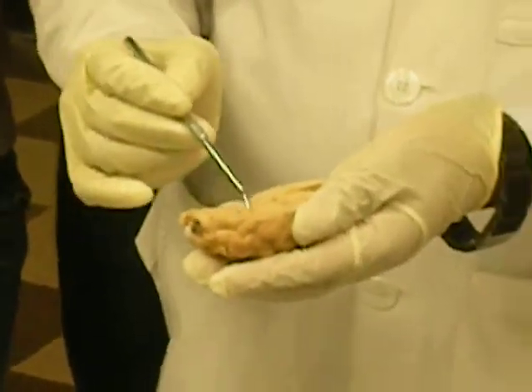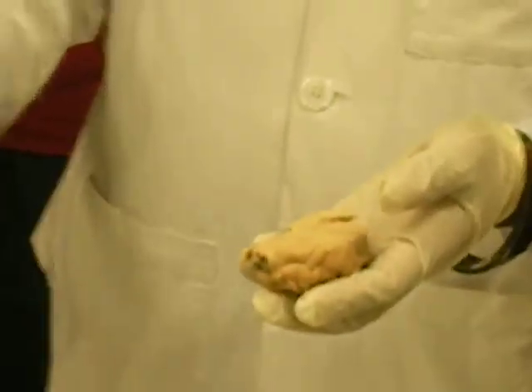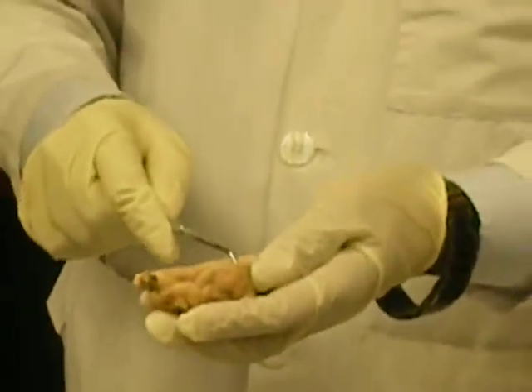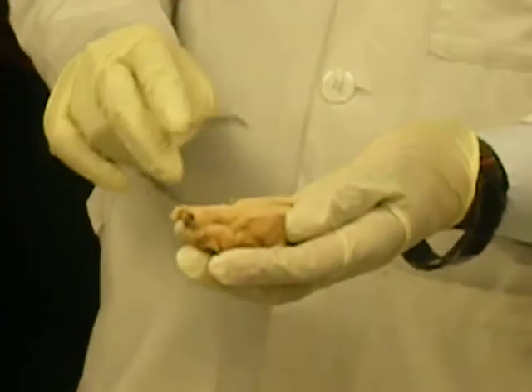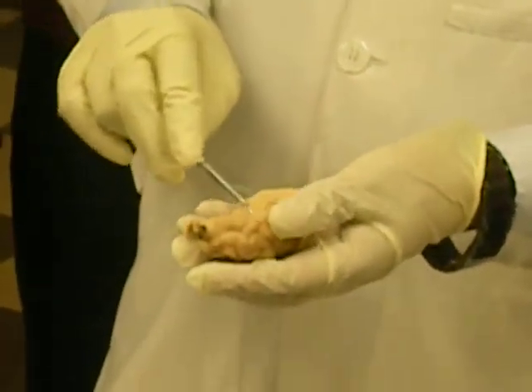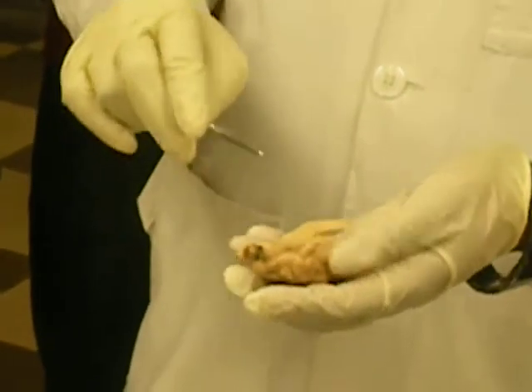And the part where we just cut is because you know that even though the brain has 2 hemispheres, deep down they are communicating. So this is the corpus callosum, where we have got the communication. Alright, corpus callosum, the commissural fibers are there. And you can also see some hole, and that is the cavity, and that is the ventricle.